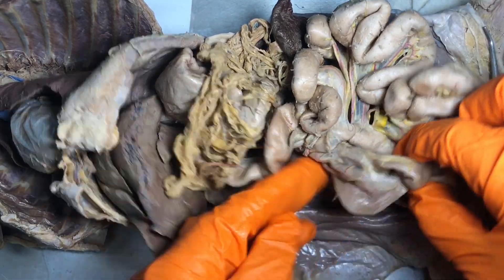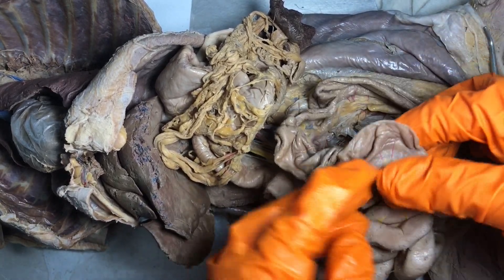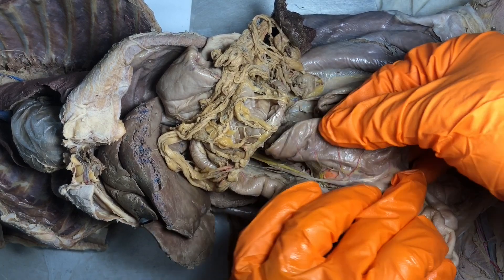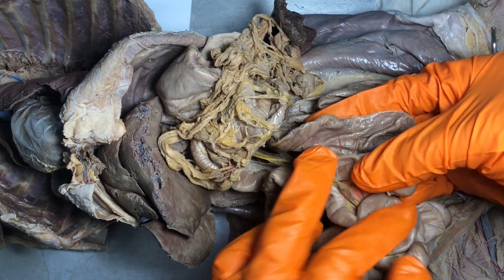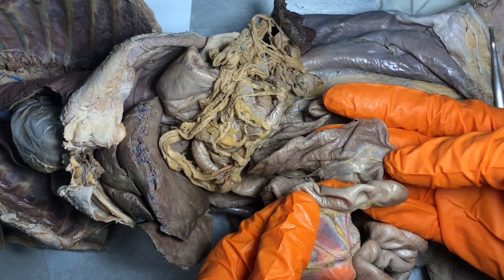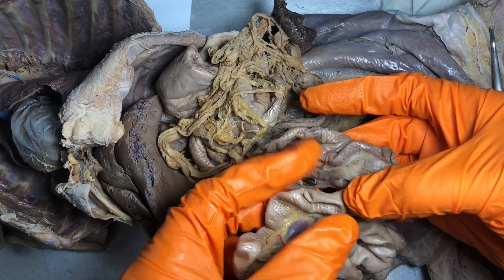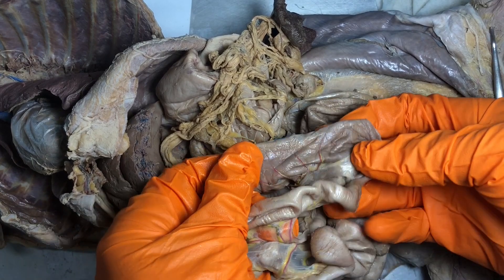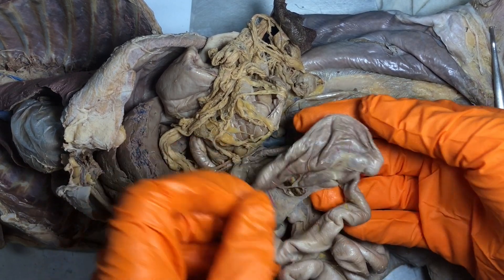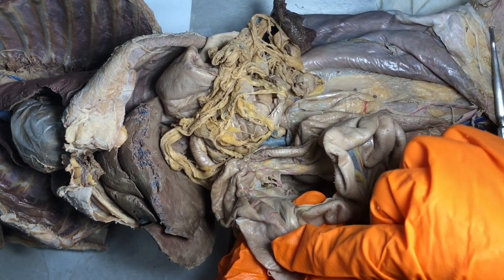The easiest way to identify the ileum on the kitty is to find the large intestine. How do we know small intestine from large intestine? The name tells us a lot — notice that this tube right here is a lot wider than this tube right here, so this is clearly the small intestine and this is clearly the large intestine. Always have a reference. When you find that large intestine, you know the ileum is going to be the distal end of the small intestine and the part that connects directly to the large intestine.